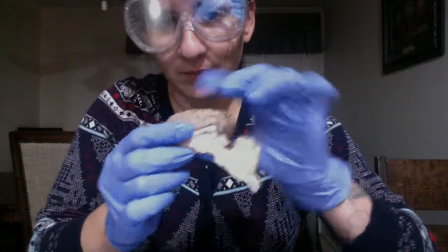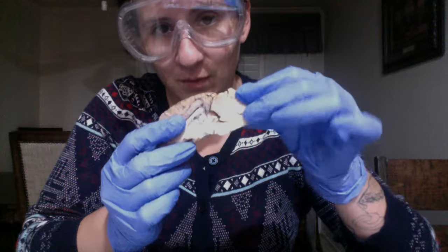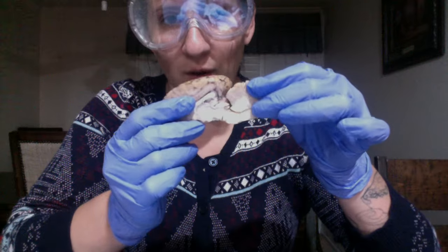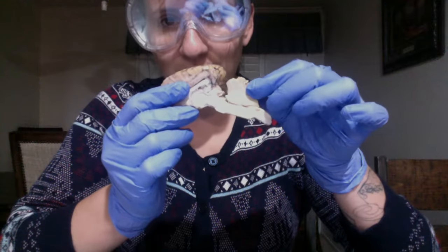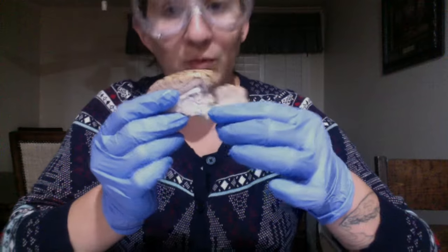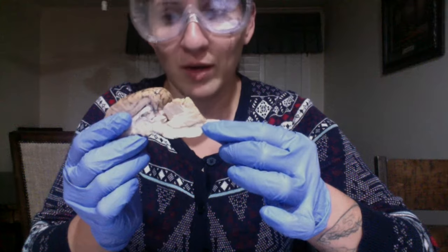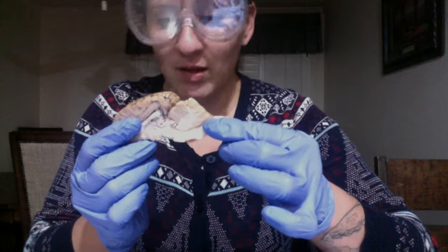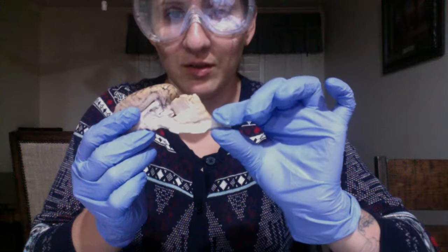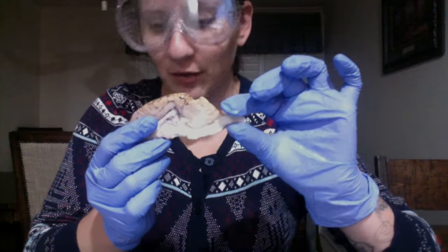So here in the cerebellum, if you look closely, you can actually see the gray matter and the white matter. There you can kind of see it a little bit here. Once we go down to the cerebellum into the spinal cord, we have the midbrain, and the pons are located right behind the midbrain. And this little short thing here is our spinal cord.